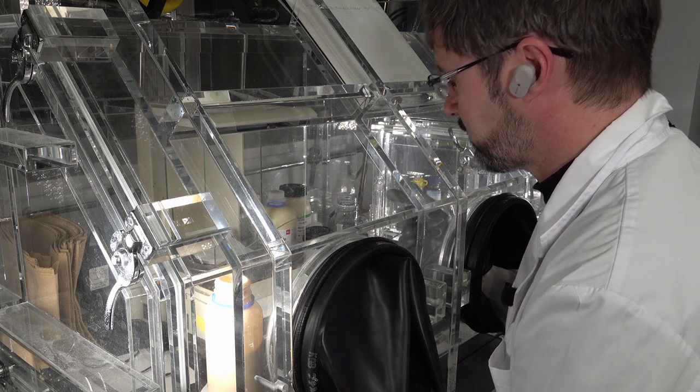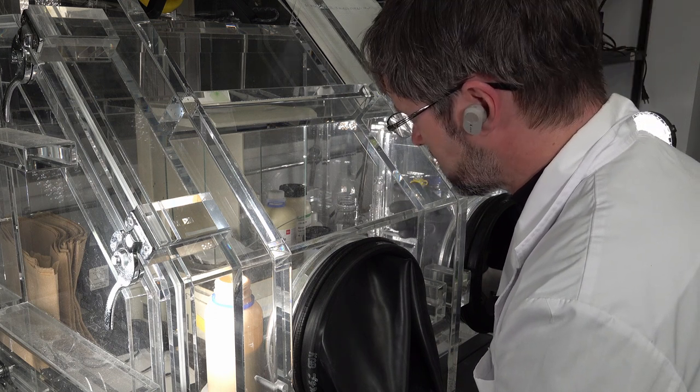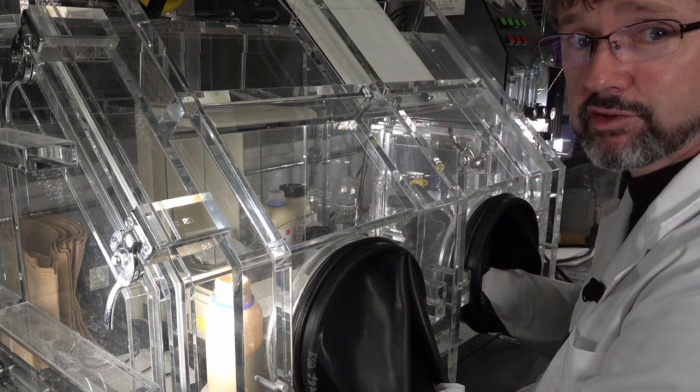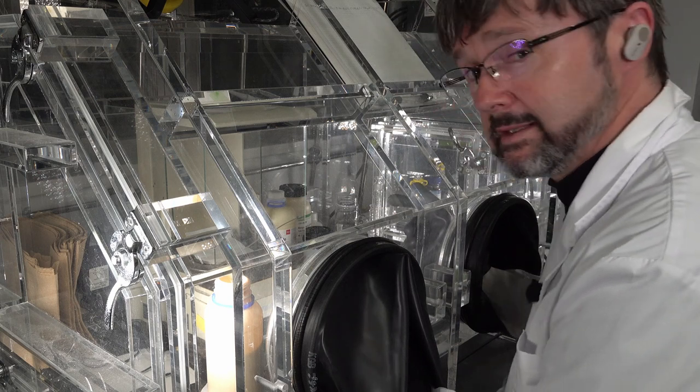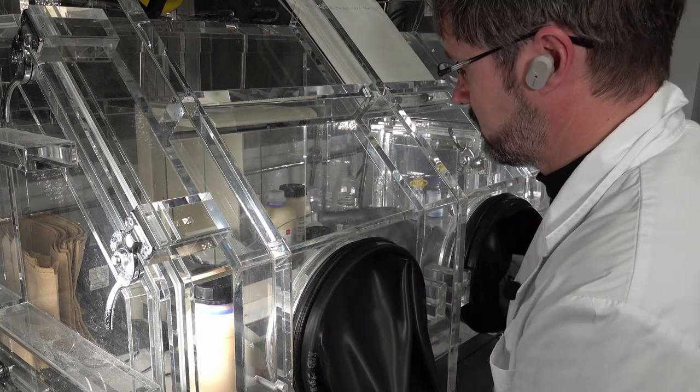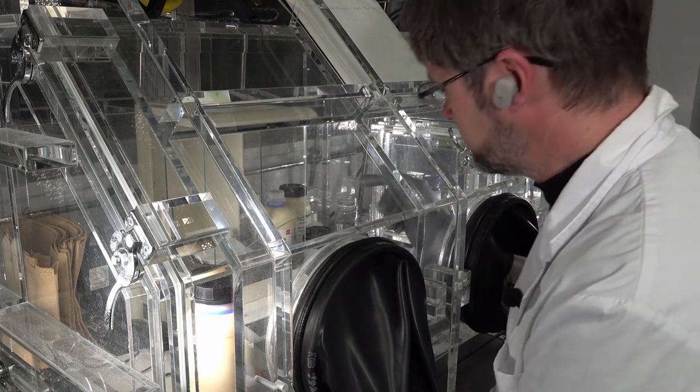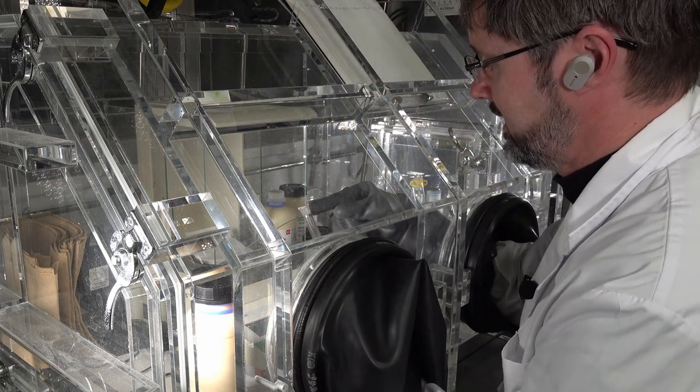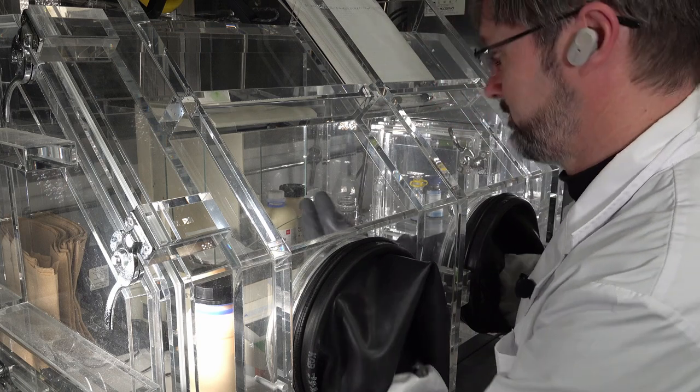Also when I add it into the flask, I expect to lose a grain or two anyway, so I think that'll do. Now all I have to do is get all of that from in there into here without spilling any of it.